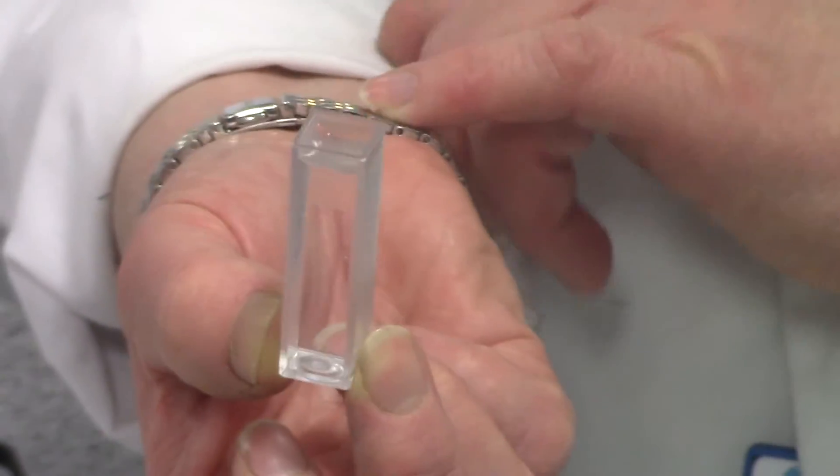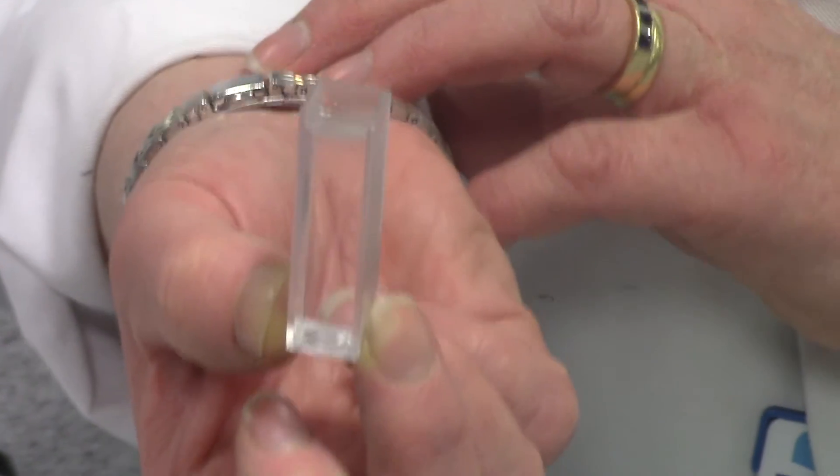You fill your cuvette initially with distilled water because this is going to be your reference value.